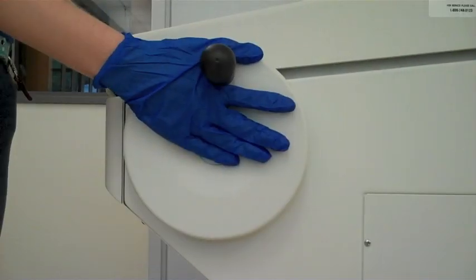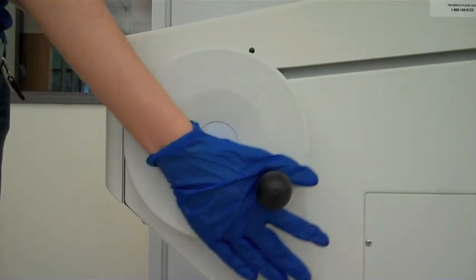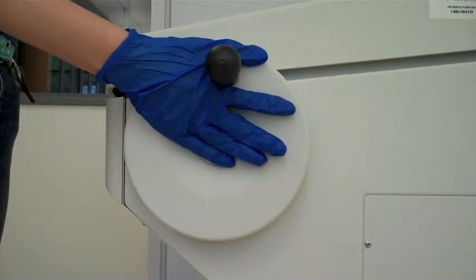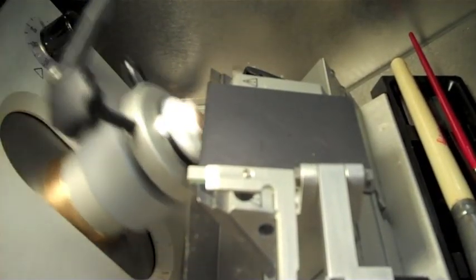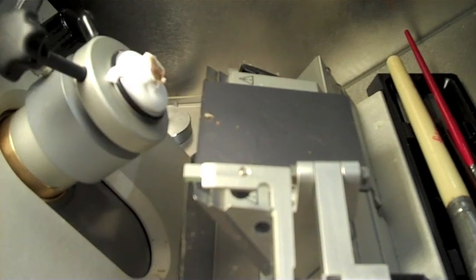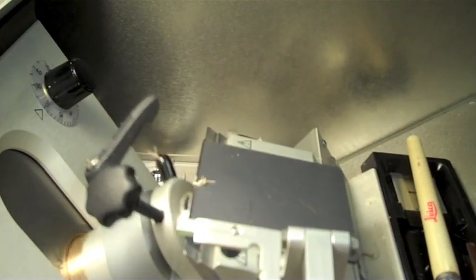Unlock the wheel. With each rotation of the wheel, the specimen holder will advance by 20 microns. Rough face until an even amount of tissue is being sectioned.